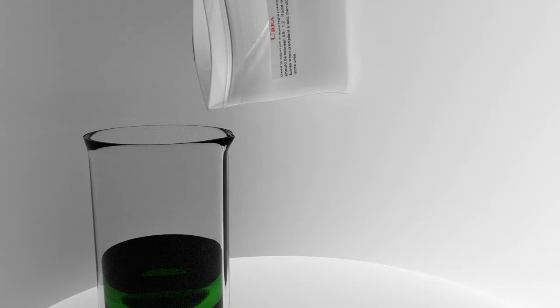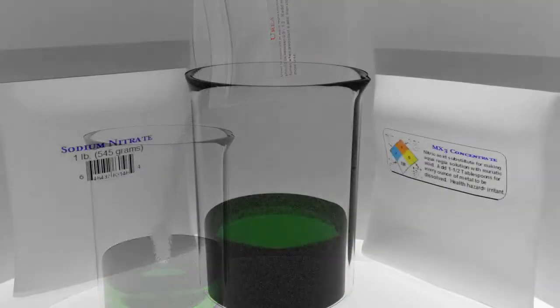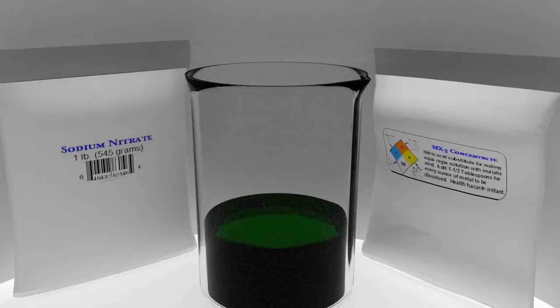If working with either sodium nitrate or MX3 concentrate, just a pinch of urea is usually all that is needed. With nitric acid, however, the quantity of urea required is usually significantly more, though the amount can vary quite a bit from batch to batch.